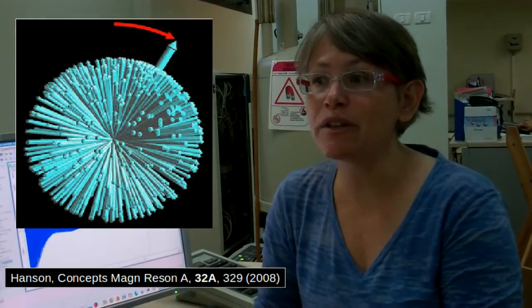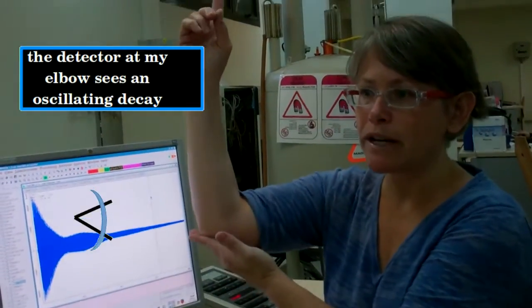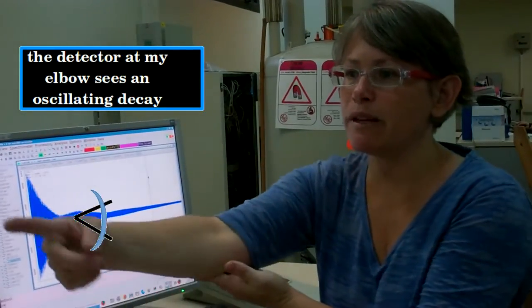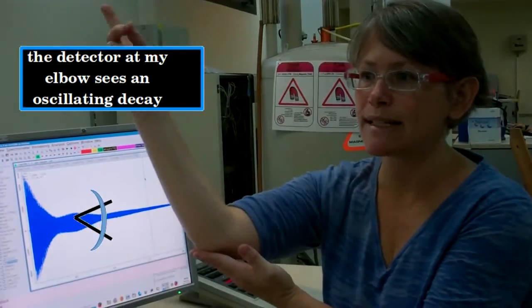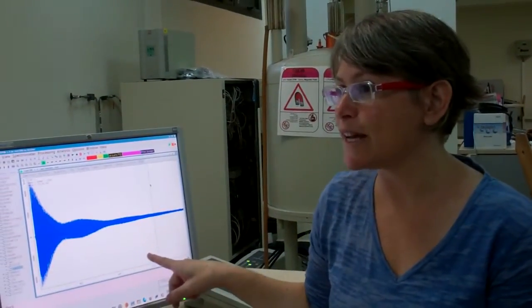On the y-axis, we have intensity. This physically corresponds to the voltage induced in the receiver coil by the precession of the net magnetization of the spin distribution that was temporarily reoriented by the transiently applied RF pulse. Once freed from the influence of the pulse, the observable signal will die off due to relaxation processes. That's this exponential decay of the FID that we observe as a function of time. Time in seconds is our x-axis.